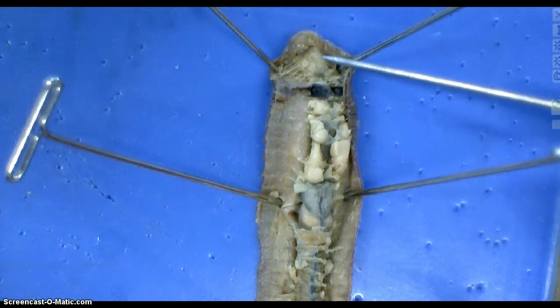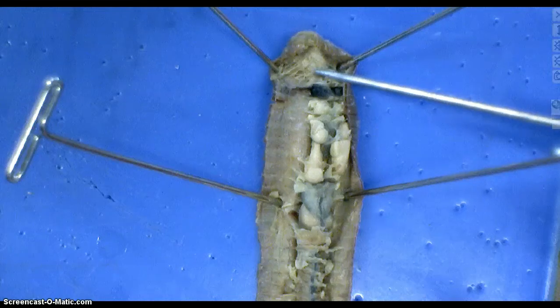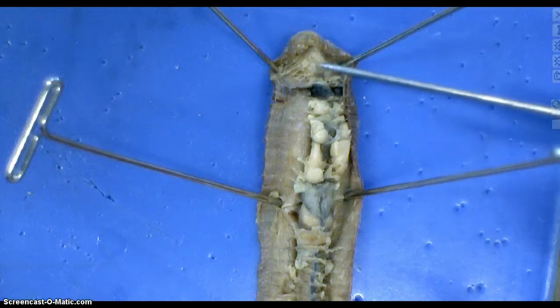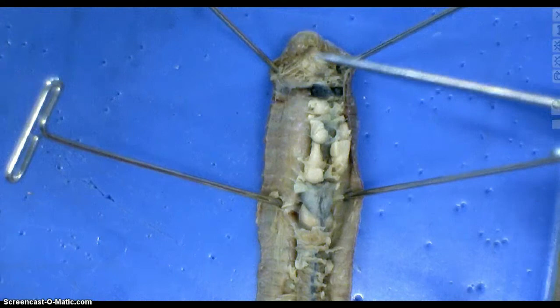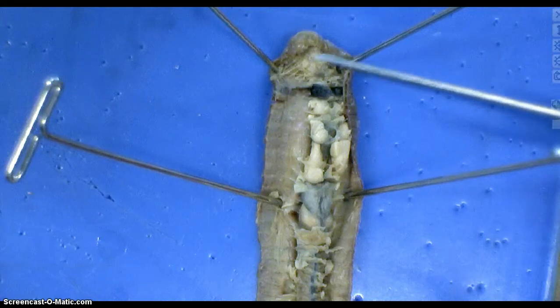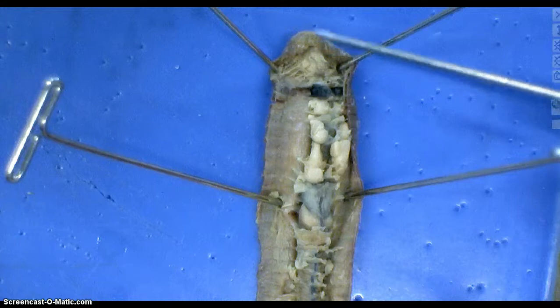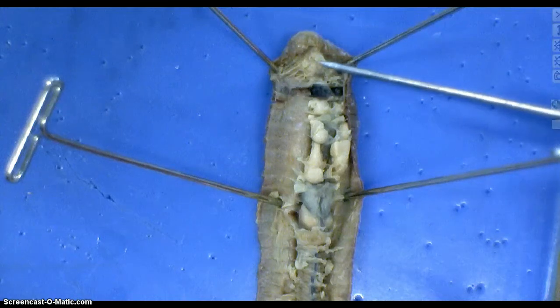That's the cool thing about worms — this thing actually shoots out of the mouth and then comes back in. And when it does that, it grabs food and other bits of soil, and that's what it swallows, because it doesn't have a way of putting food in its mouth. So this structure elongates, comes out of the mouth opening, grabs food, and comes back in. It's actually pretty cool.